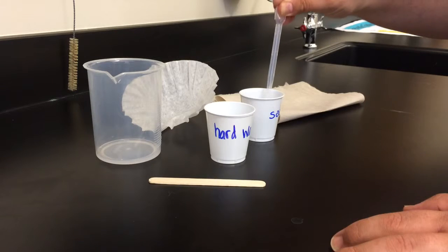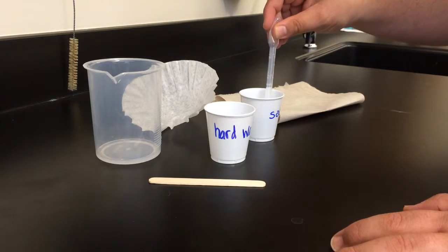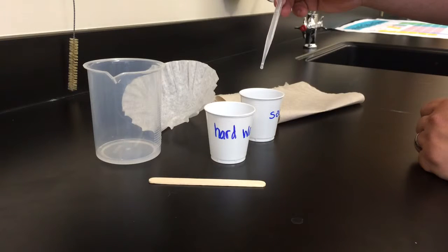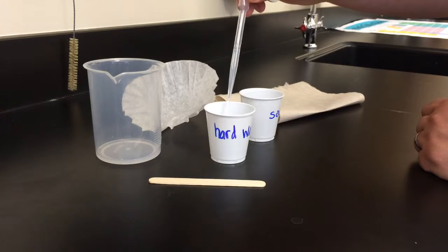Now as I do this and I keep drawing off more and more of this, if I get a piece of soap, I just have to squeeze it back out to get rid of those pieces of soap and then add it over here.